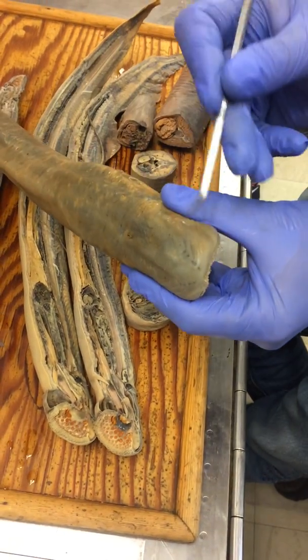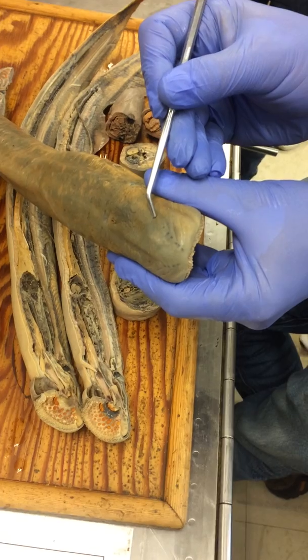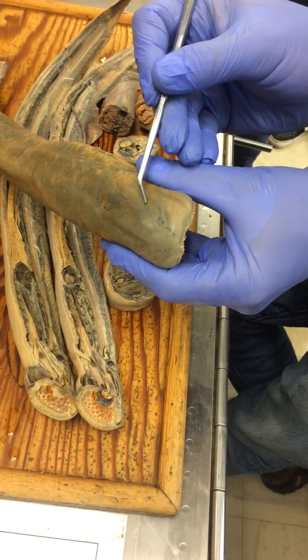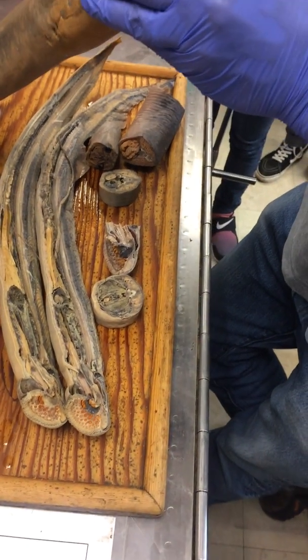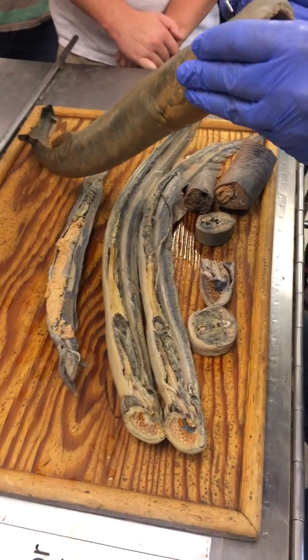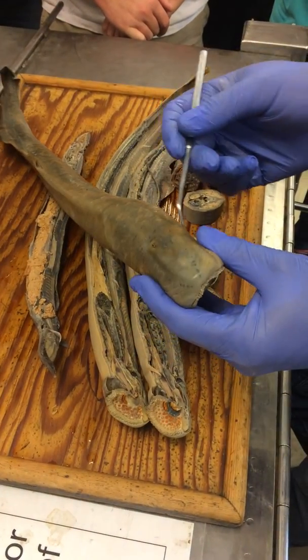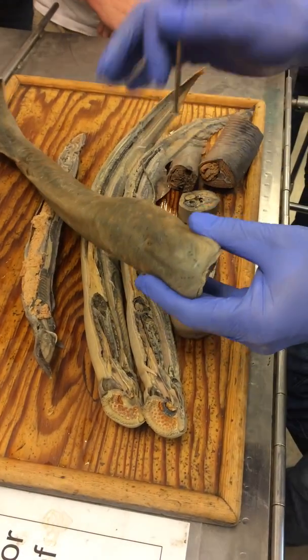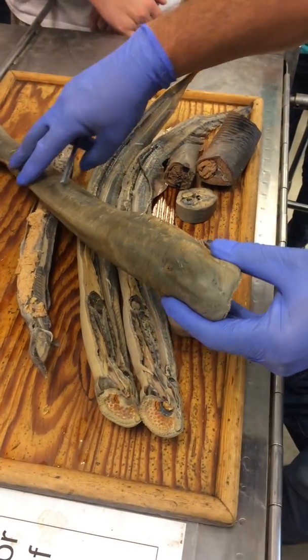You can also see these rows of pits right here on the head. What would those be? That's the lateral line system. It shows up way better on the head as these rows of pits than it does on the trunk on these guys.